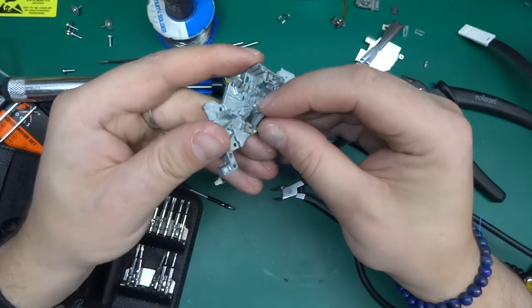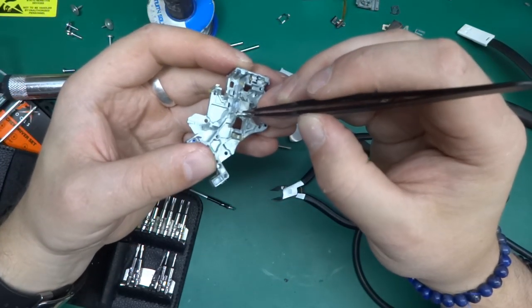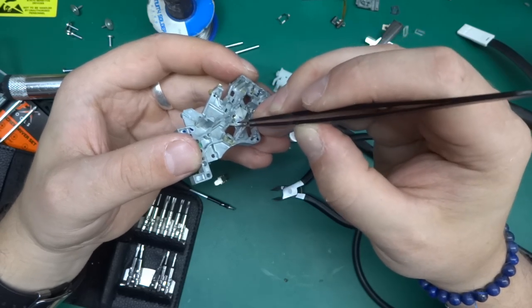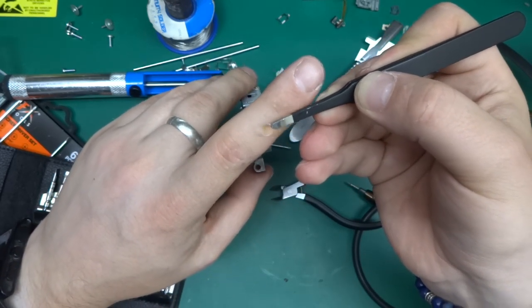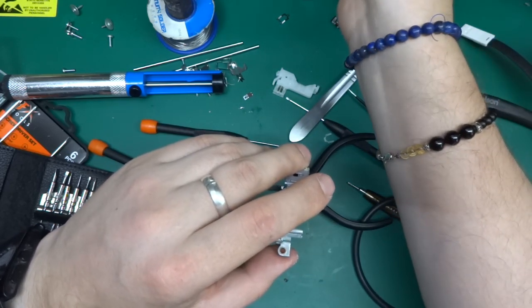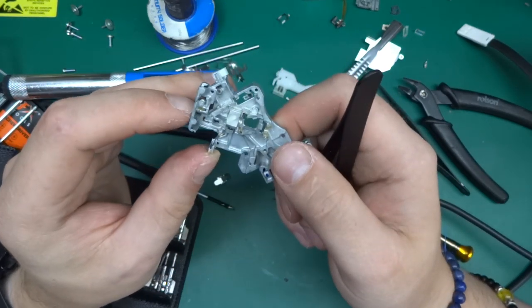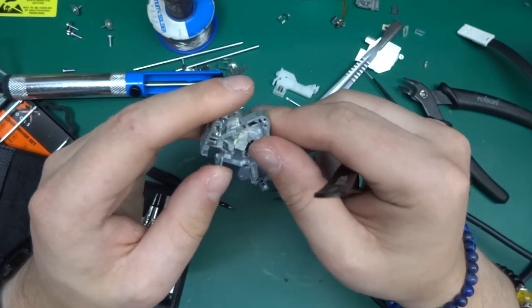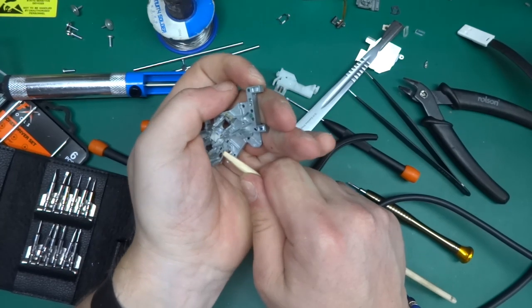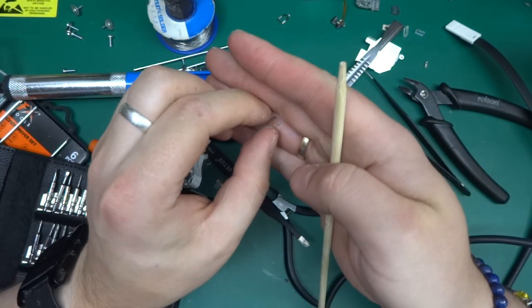Okay, my battery keeps dying even though it's on charge, but what I've noticed, and that's good news, is that the lens is not held really hard. So there we go. This is the lens that we're after. So let's put that aside on something soft. And there are two things left in here. There is a tiny lens over here, which I will attempt to take out, and the beam combiner thing. There we go, that came out nice.